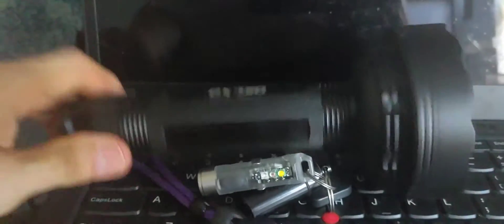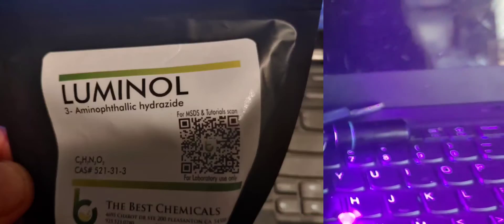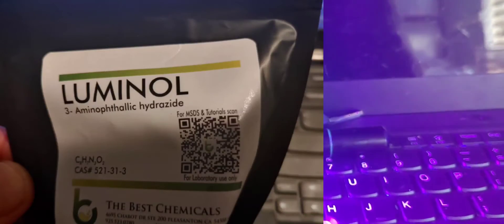We thought maybe the first UV light just wasn't strong enough, so we went ahead and got a giant UV flashlight with 132 bulbs, thinking that would make the blood light up. Sure enough, it still didn't light up, but it lights up all kinds of other stuff — it's crazy for urine, works great. So we started reading into it more and found out that it isn't UV that makes blood light up; it's actually luminol. That's how we started researching luminol.